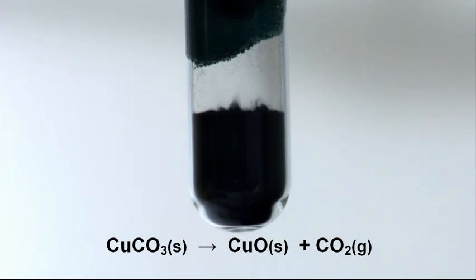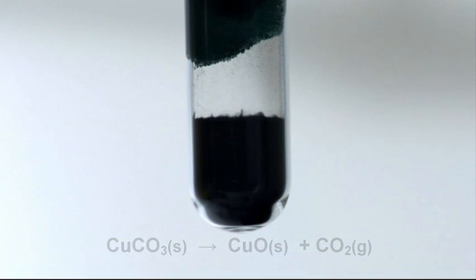The solid copper(II) oxide settles at the bottom of the tube when all of the carbon dioxide has been driven off.